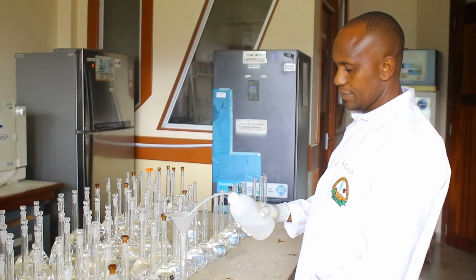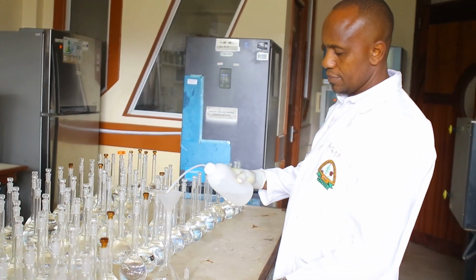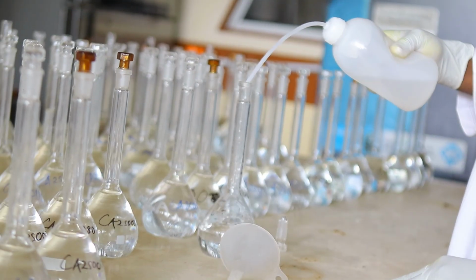Most of our clients would include individuals, but we also carry out monitoring activities where we go around collecting food samples from markets and farms. And this is just to protect and promote food security. We also have a big group of researchers who bring samples for analysis in this lab. And as part of these activities, we're also promoting trade to ensure that whatever goes out of the country meets the requirements in the outside markets.